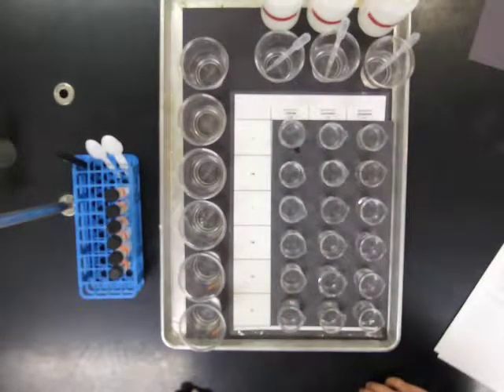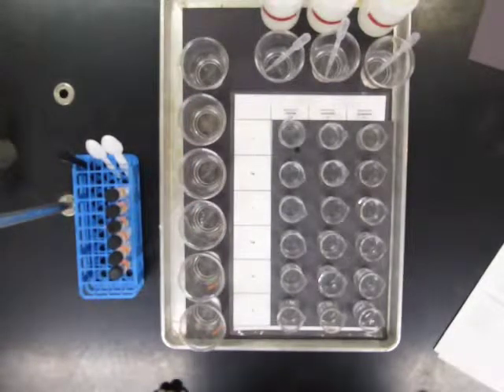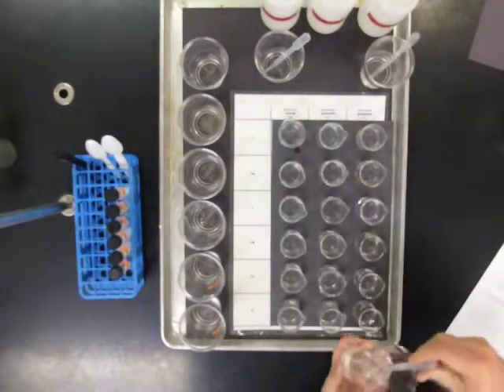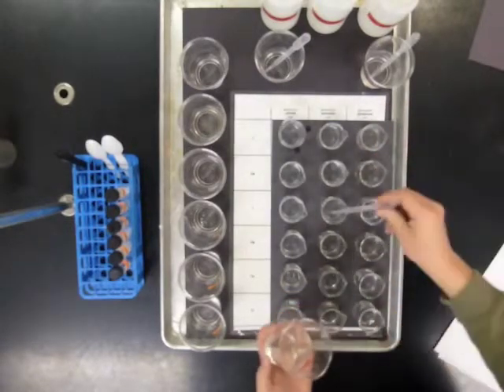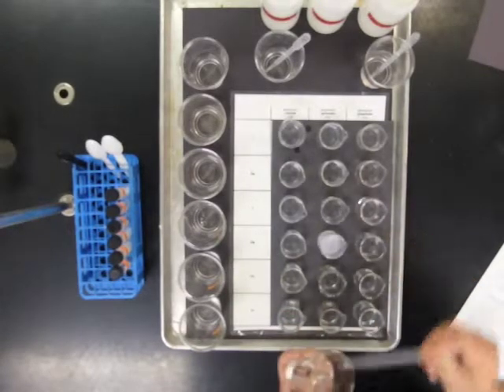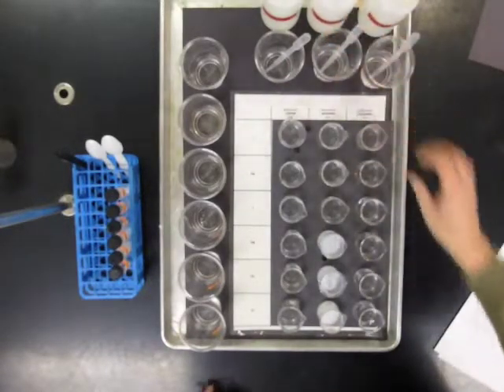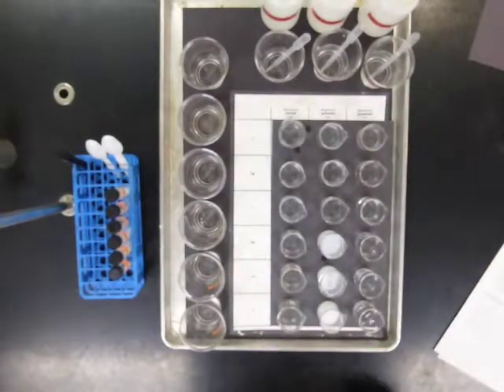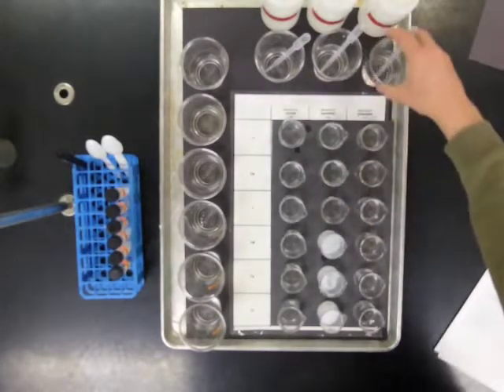So there's nothing there that we can use to tell any differences among these 6 compounds and the way that the elements react. So let's see if the carbonate gives us some other information. If we put carbonate into each of the 6 metallic nitrate compounds, we'll see if any of them give us reactions. Magnesium, calcium, and strontium all show a chemical reaction. Some insoluble material is formed, and carbonate then reacts with something that's in the compounds that contain magnesium, calcium, and strontium, but not lithium, sodium, and potassium.